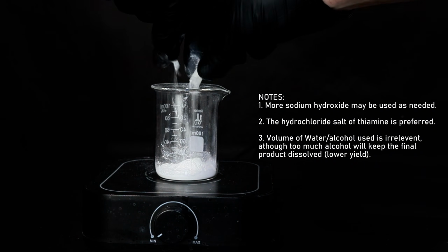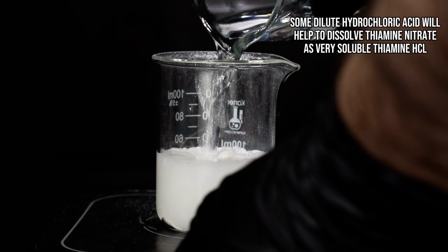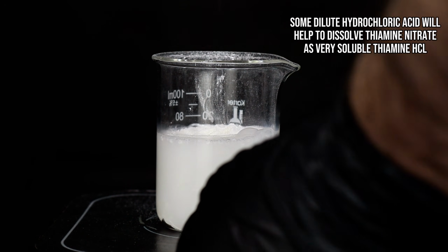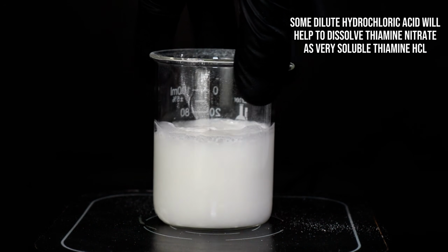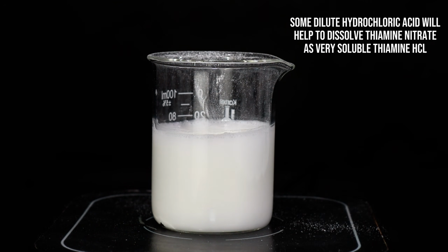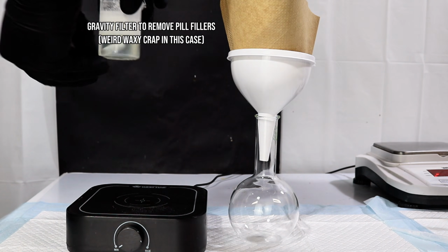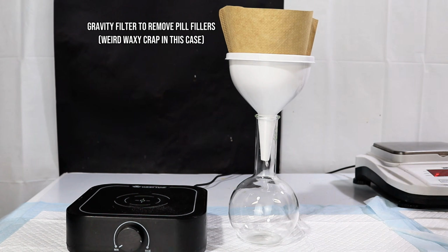However, this is pretty easy to fix, and to get it to dissolve completely, I next went ahead and added 50 milliliters of 0.25 molar hydrochloric acid mixed with 20 milliliters of methanol. The hydrochloric acid will quickly convert the barely soluble thiamine mononitrate to highly soluble thiamine hydrochloride. And after only a few minutes of mixing, all I had to do now was pass the mixture through a coffee filter to remove whatever fillers were present in the capsule.